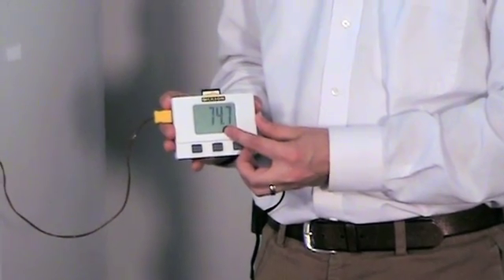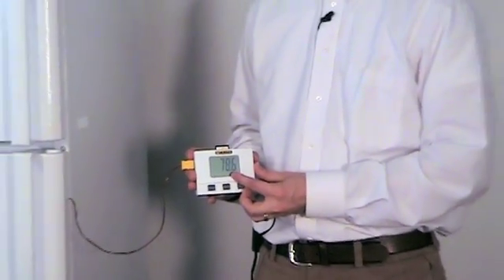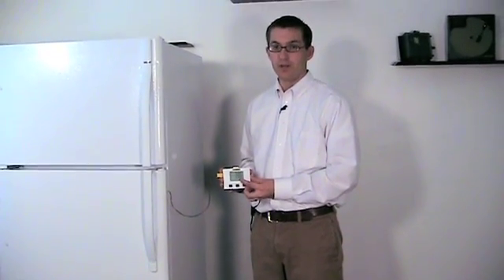This does not clear the data from the unit but just merely transfers it to the memory card.